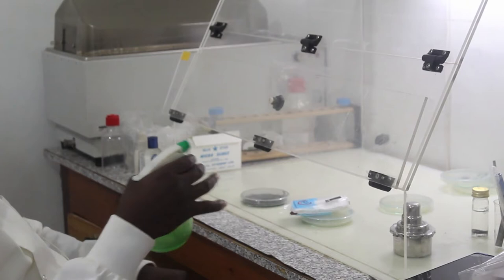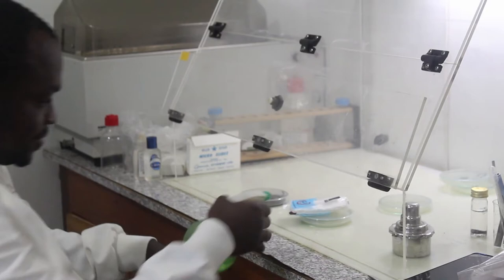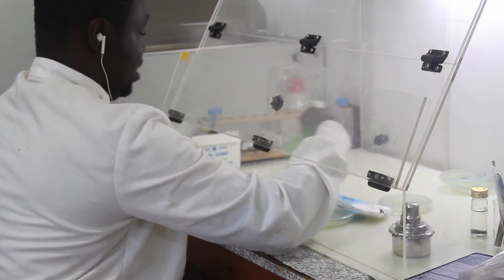First, we will sterilize the laminar flow with a 70% ethanol concentration. This is to help reduce the contamination we experience in our work.